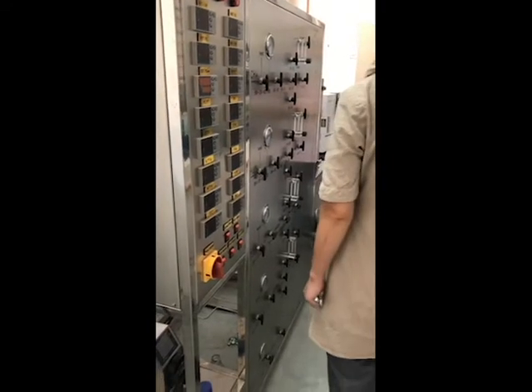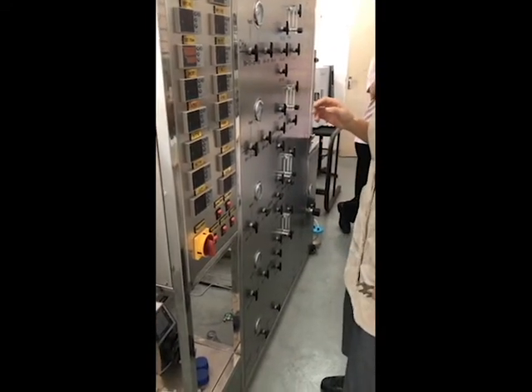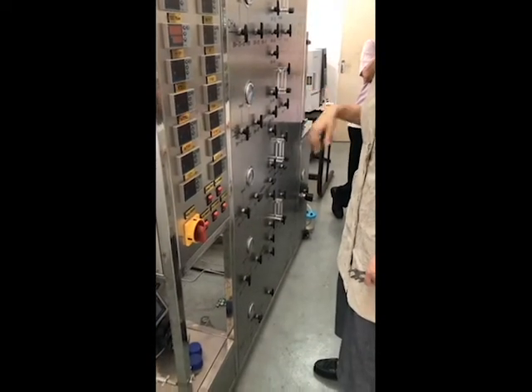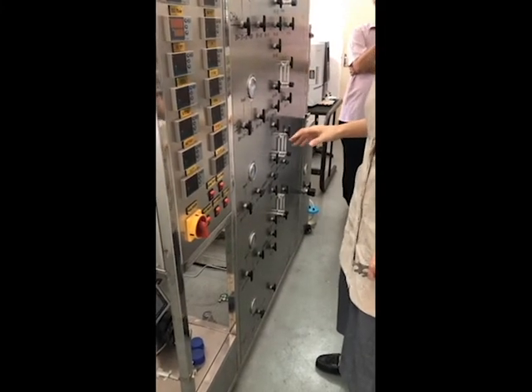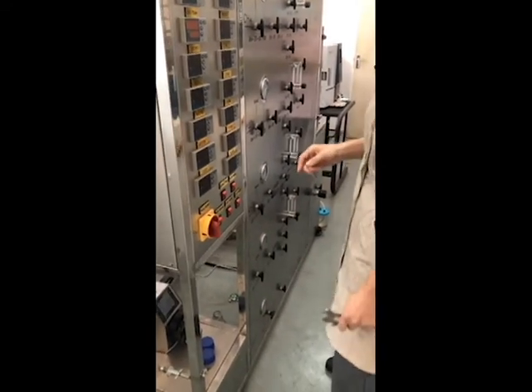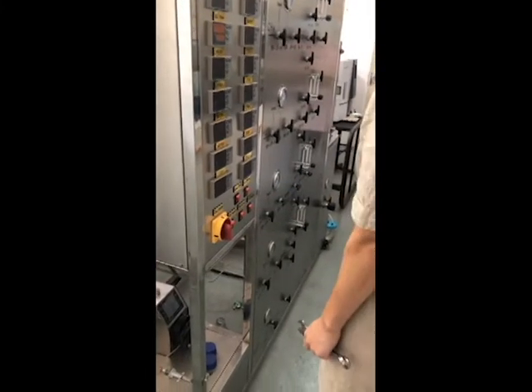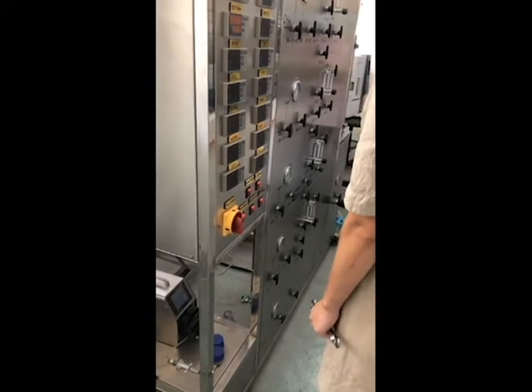Another way is, besides your operation or collecting samples, you don't come into this room. You can observe from outside, because everything is controlled automatically. You only come in to collect samples or adjust anything. Besides that, you don't need to stay here to observe it, or you may get a headache. Aircon better off or on? Because you also need to come to collect samples, you have to enter.